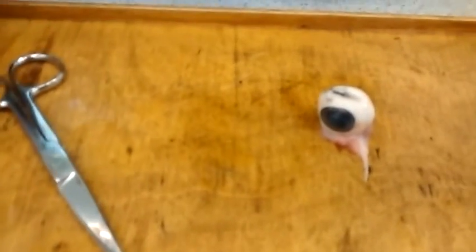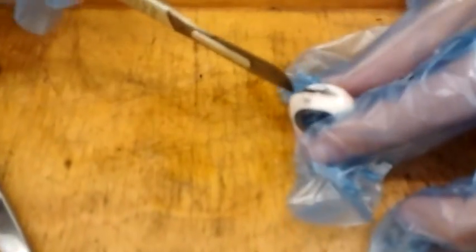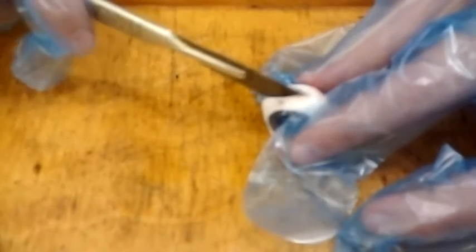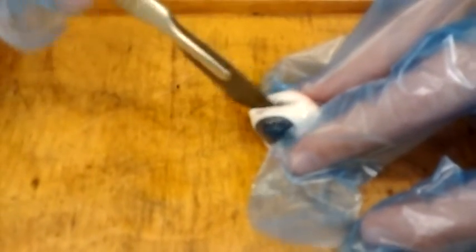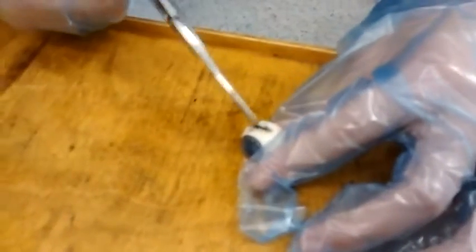Oh, look at the lens. It's amazing how tough the eyeballs actually are. Kerry, do you want to try the scalpel? Yeah. Don't cut towards your hands — turn it the other way around. Kerry, like this. I'm scared I'll probably cut the lens.